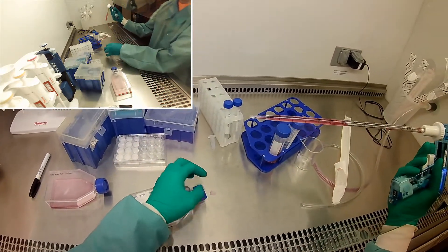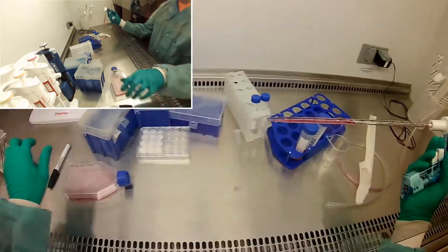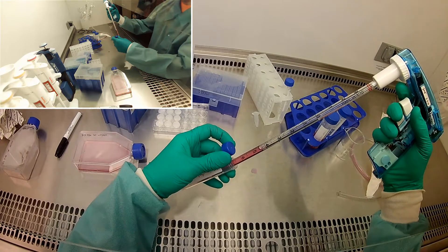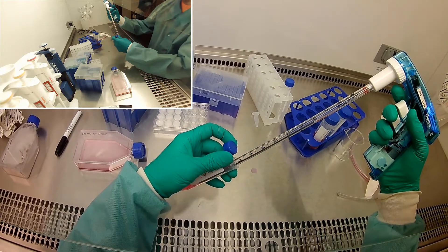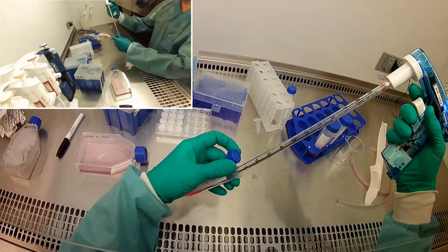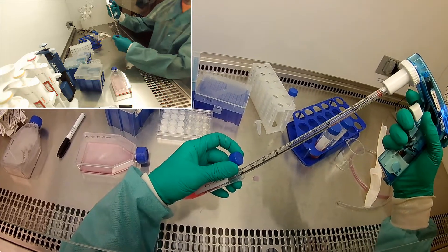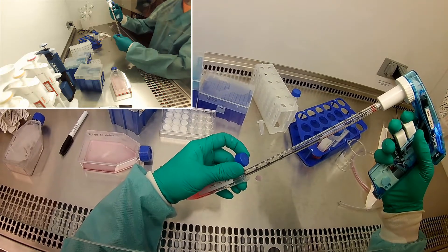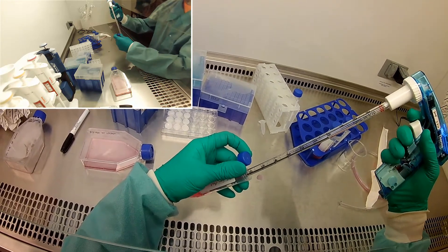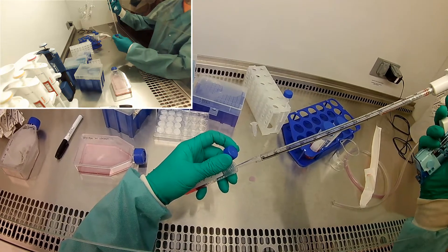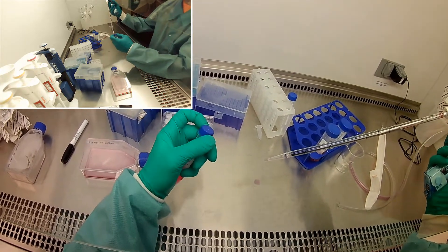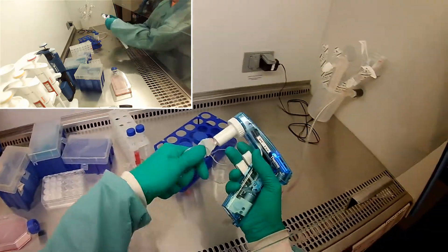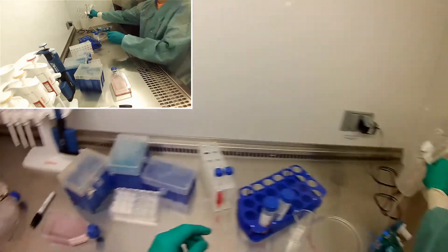We're not too concerned about this flask anymore. I'm going to put my cells in here. I'm going to mix them. I want a good homogenous mixture when I count and when I feed. Okay, that's pretty good. I ended up blowing some bubbles in there, which is not nice.